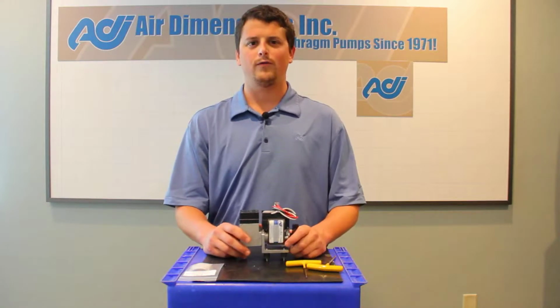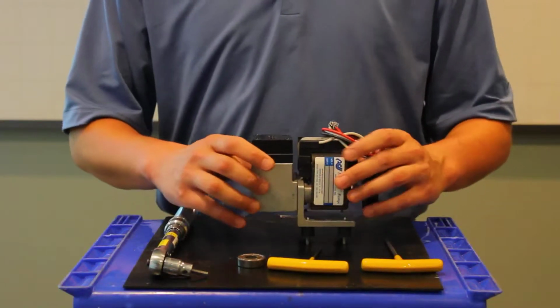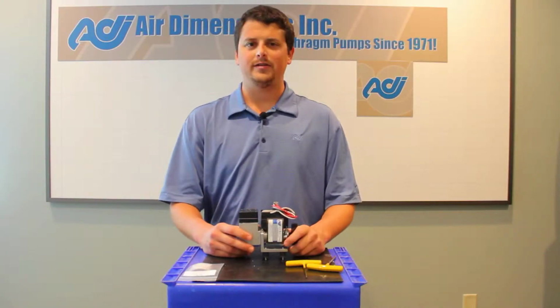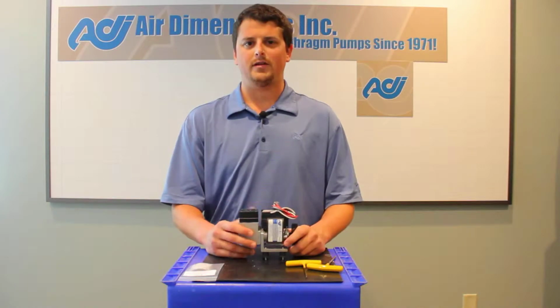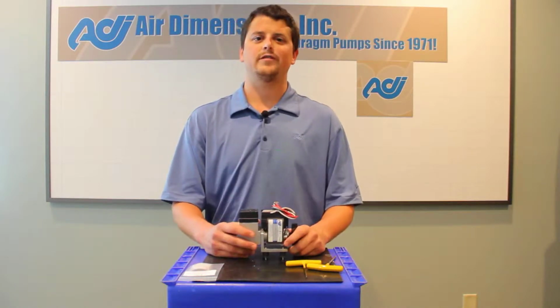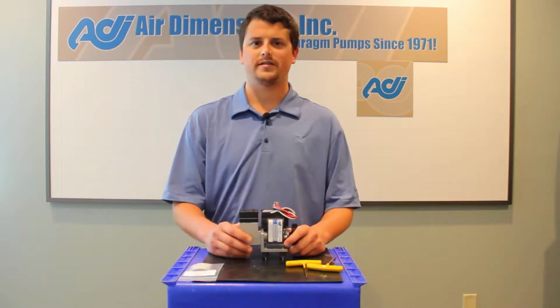Today we're going to be going over how to change a diaphragm on one of our Micro Dia-Vac diaphragm pumps. Well, when changing out a diaphragm, it's typically done because the pump's starting to get a little bit of low performance. It may be low pressure, low flow, or some people just want to service the diaphragm at regular intervals, whether that's 6 months or a year. Really just depends on the application.